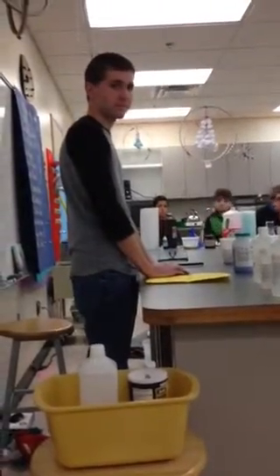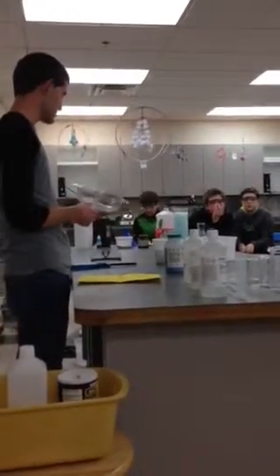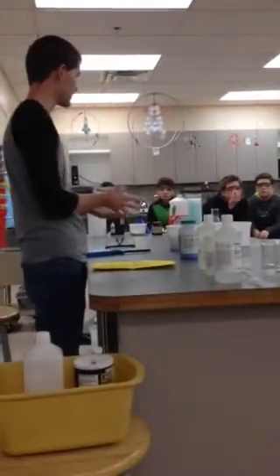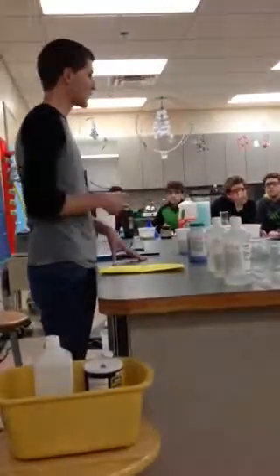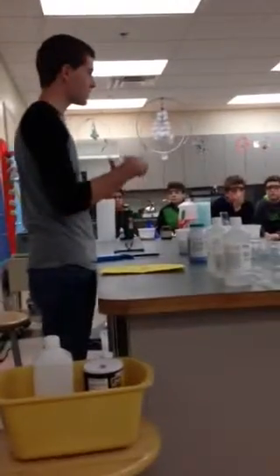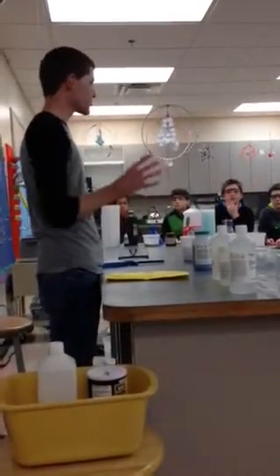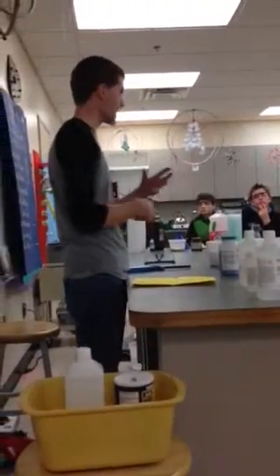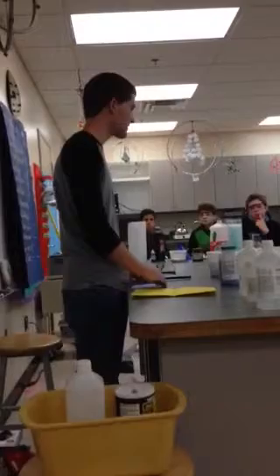No. Okay, good. So when I add energy to this copper sulfate, you're exciting the electrons in the outer shell of the copper sulfate. Remember, it was the cesium. Cesium had six electron shells. The outer shell is the one where the electrons are reactive. They get the brunt of anything that happens to that cesium.